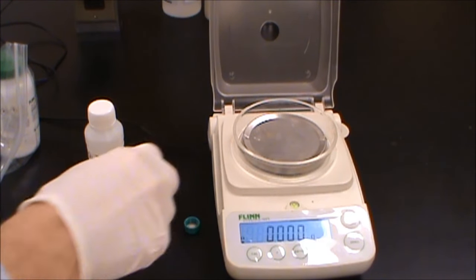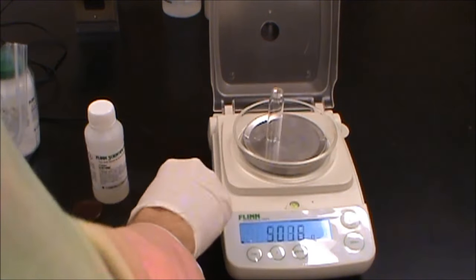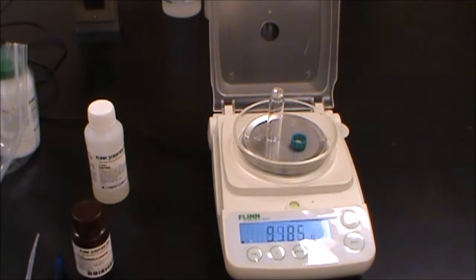This is the synthesis of indigo. What we're going to do here is we're going to do this quantitatively and then we're going to do some qualitative experiments afterwards.